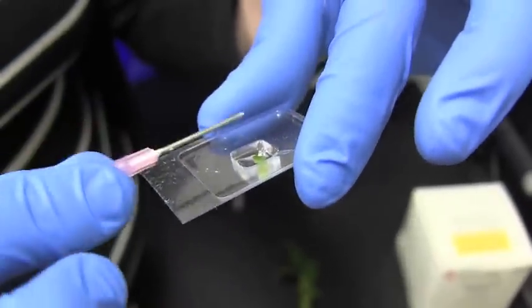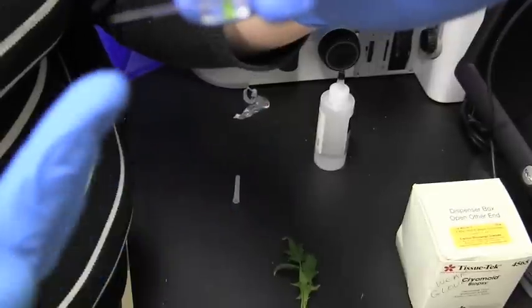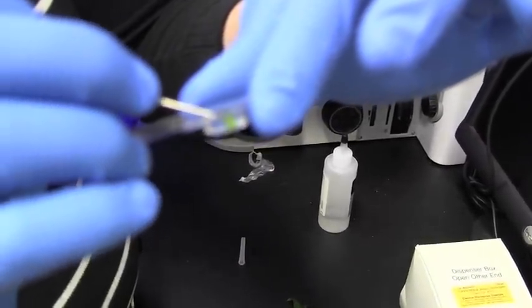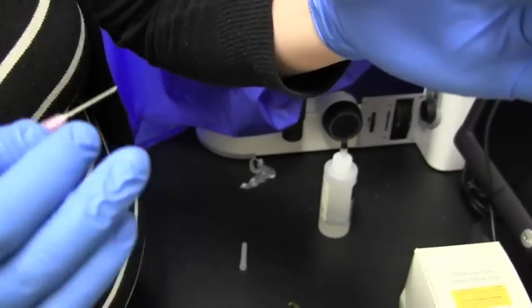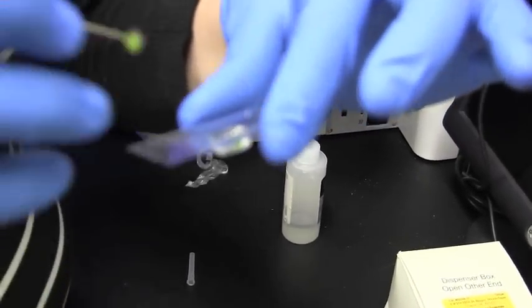When loading the sample, you want to have the cutting edge on the bottom. So what you're going to cut into will be this side right here. The orientation of your sample is really important at this point. It needs to be very flat and flush against the bottom.